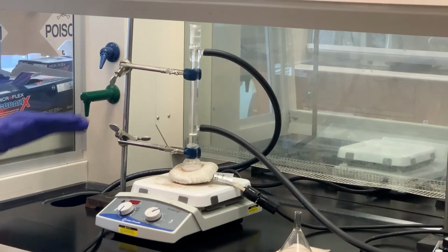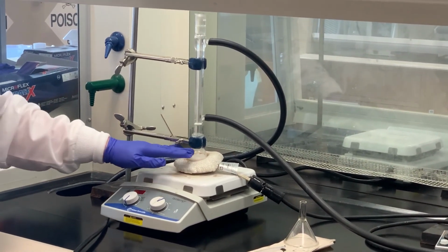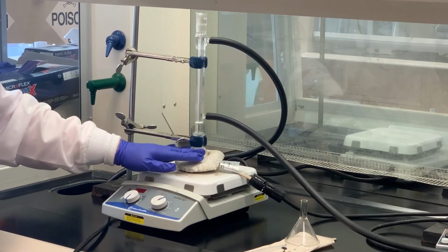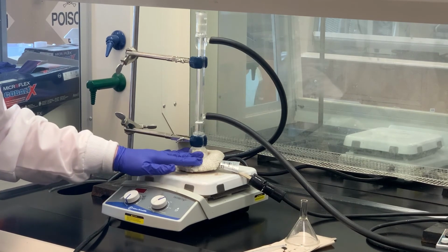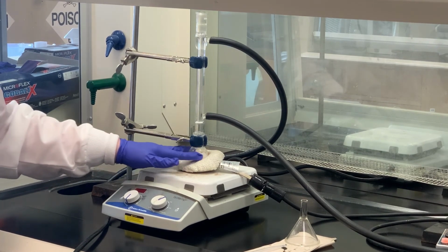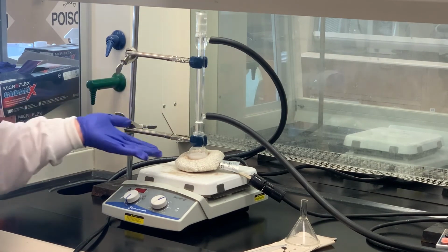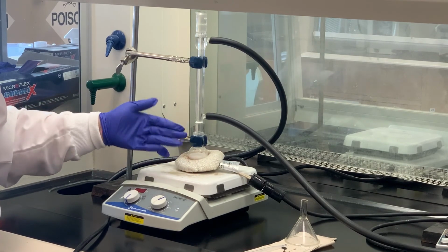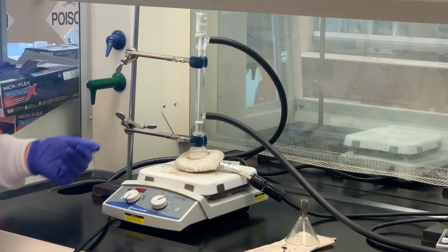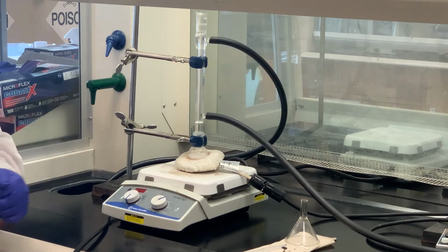I've turned the variac on. We're using the heating mantle as our heating source with the variac. And I'm going to monitor. As soon as it starts refluxing, we'll come back and take a look at what it looks like. Once it starts refluxing, we'll count 30 minutes. If all the solid has dissolved at that point, we'll go further to collect the product, the benzocaine. If there's still solid left, we'll need to add another small amount of ethanol and a little bit more of the acid catalyst, the sulfuric acid, and heat for another 30 minutes. We won't know until after the first 30-minute period ends.